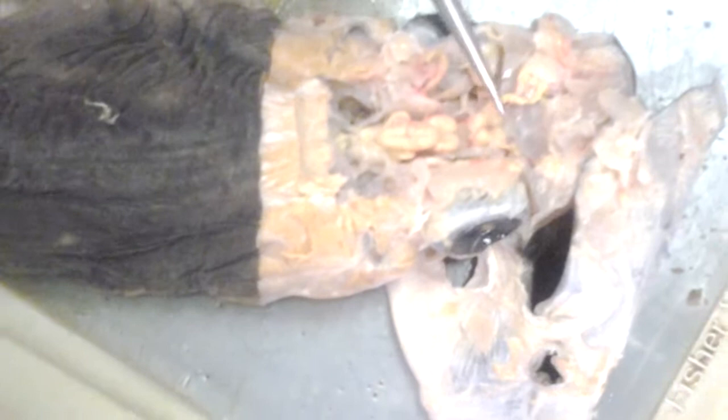You said something about a sac? Olfactory sac? Yes. No, I thought sac before bulb. The olfactory sac is towards the front. So this is the olfactory sac. The yellow is the bulb. Oh, okay. So the olfactory sac is here, the olfactory bulb is the yellow, then the olfactory tract.